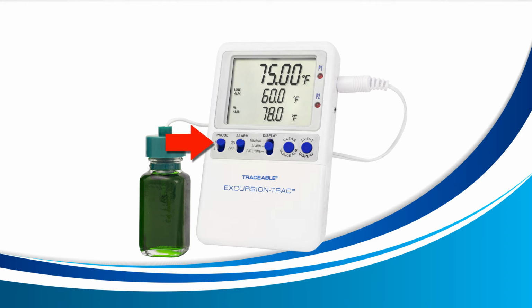Second, we'll locate the display switch on the center of your device. Move this switch so that it aligns with the words alarm. Once you do this, your LCD will change to show your current temperature at the top, the low alarm in the center, and the high alarm at the bottom.